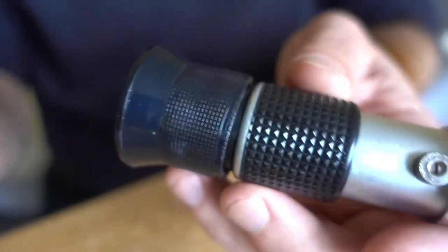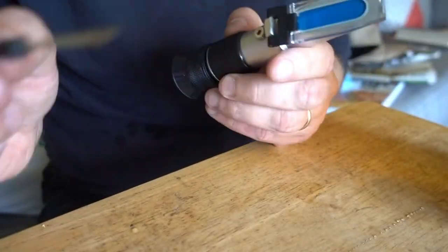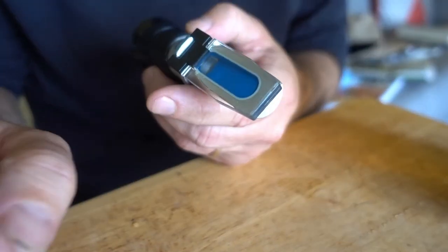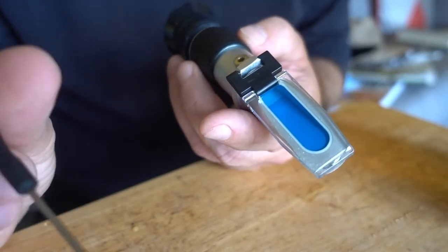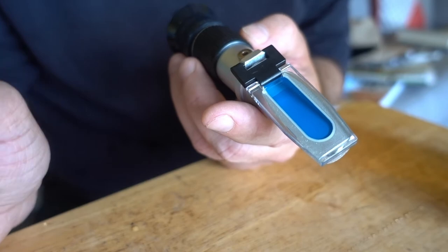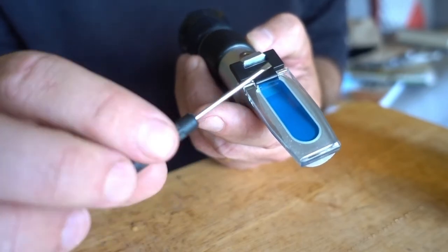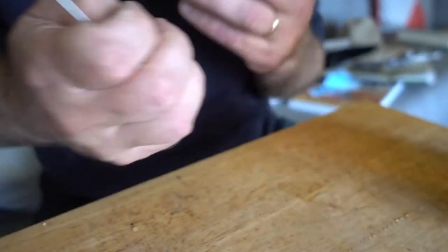So there it is, I just adjusted it to exactly 17 percent, that's it. So I've calibrated it. I've sort of cheated a bit because I knew before I even did this test that this honey was 17 percent moisture.